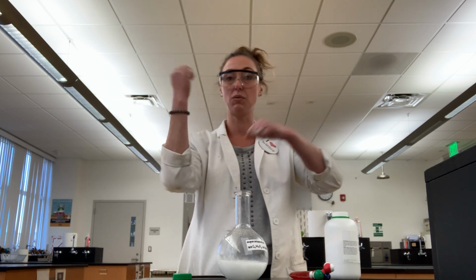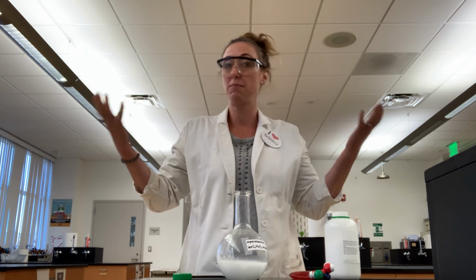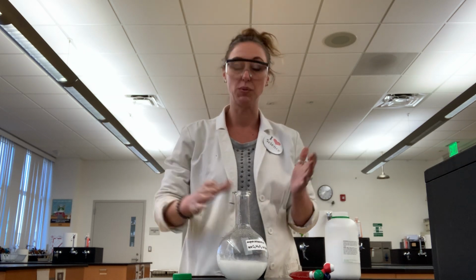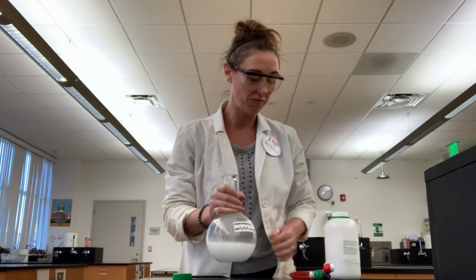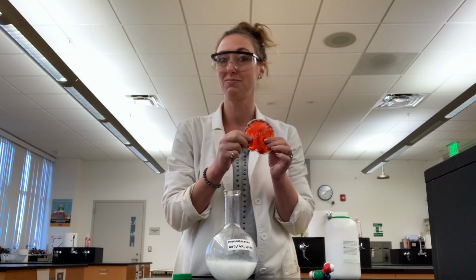Now, if you could feel it, it's also very exothermic, because those molecules are going from having kinetic energy as a liquid back to less kinetic energy as a solid. And what happens to all that extra energy? It gets released as heat. As a matter of fact, this is the same substance they use in commercial hand warmers, okay?